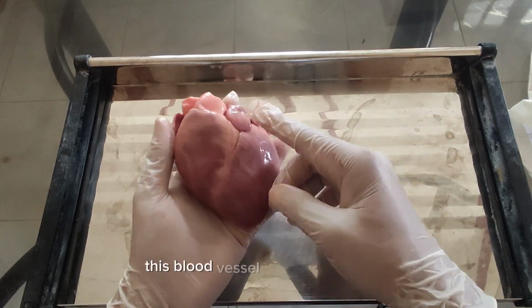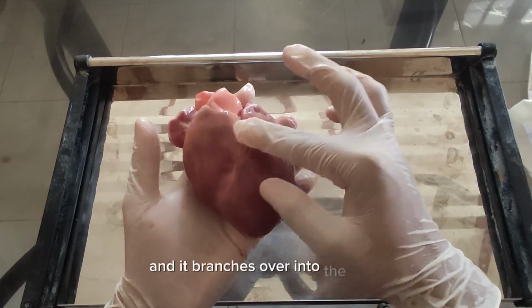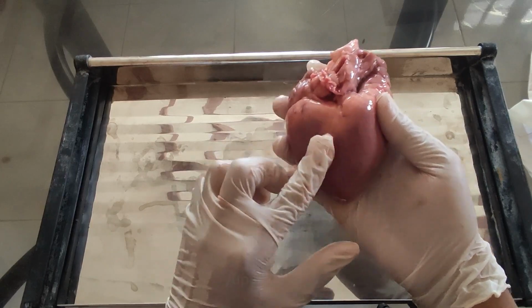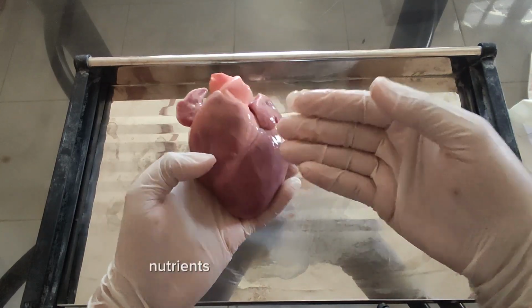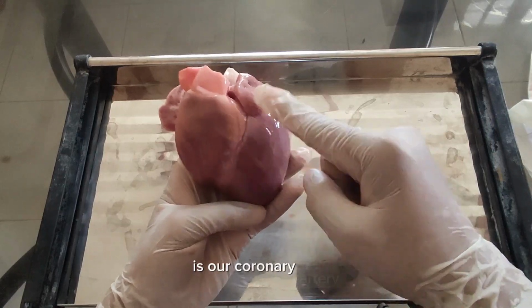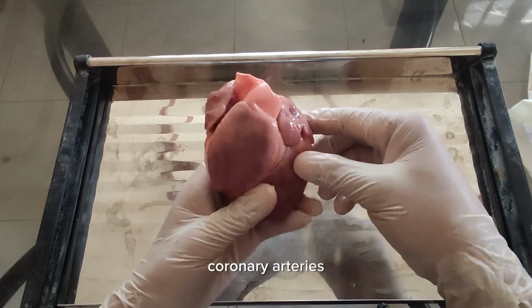This blood vessel lies on the groove on the front of the heart, and it branches over the front and to the back of the heart, which supplies fresh blood with oxygen and nutrients to the heart muscle itself. This is our coronary artery. Coronary arteries.